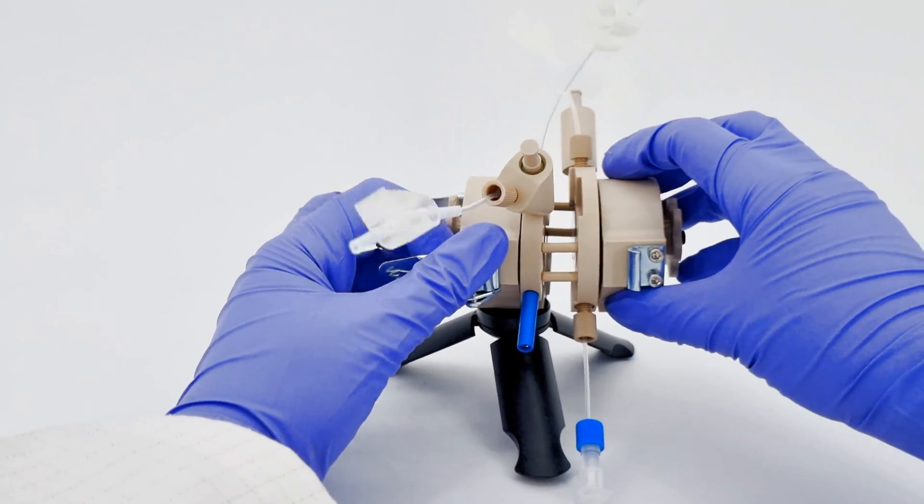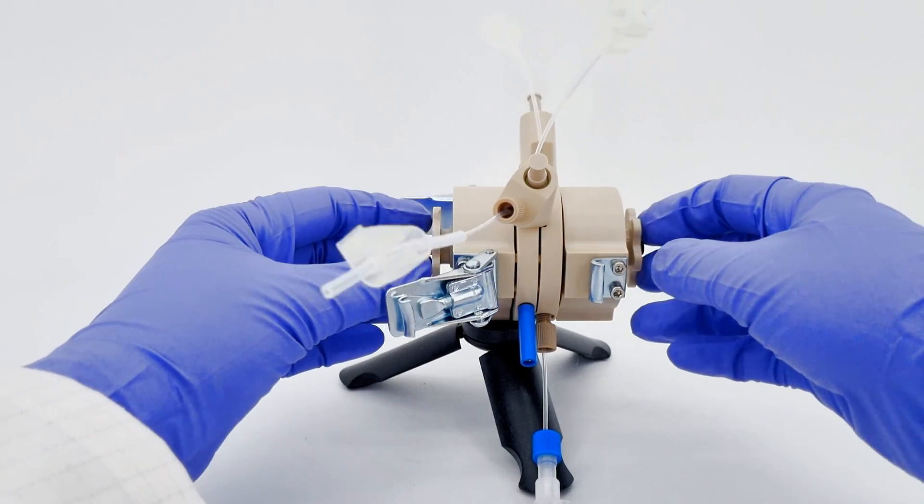Next, let's reunite our cell halves. Ensure they align using these handy alignment pins.